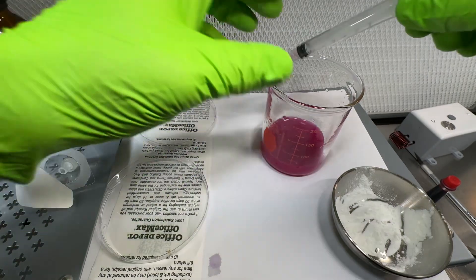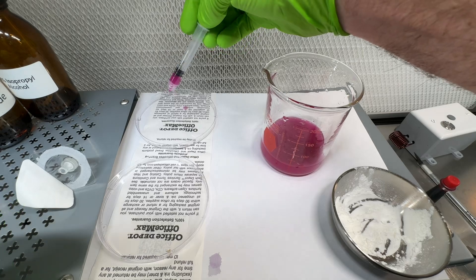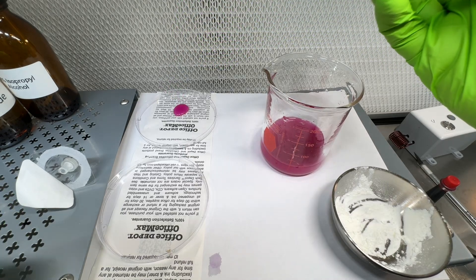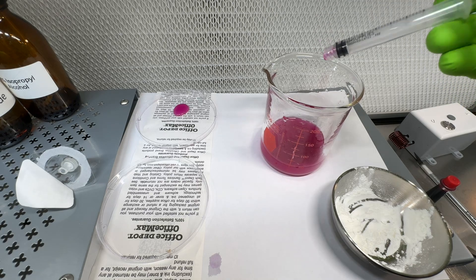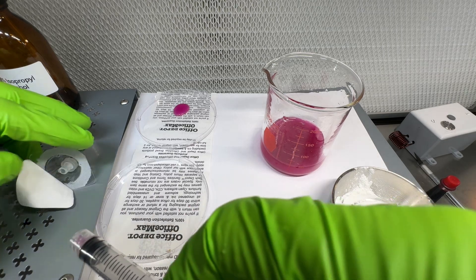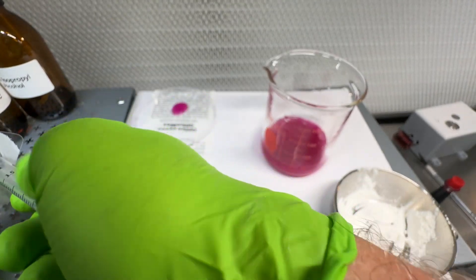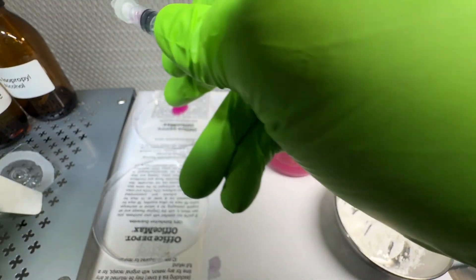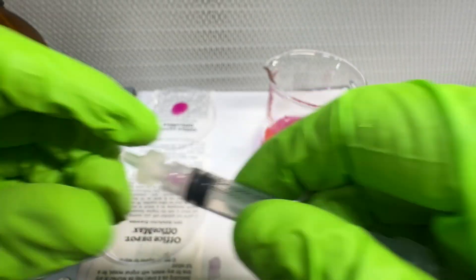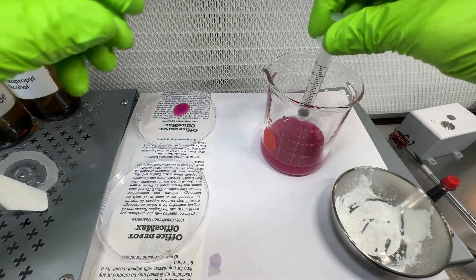First I'm going to draw some of this up and put it here so you can see it. You can't read the newsprint underneath at all. What this represents — this blob that you can't see through — is a peptide contaminated with bacteria.